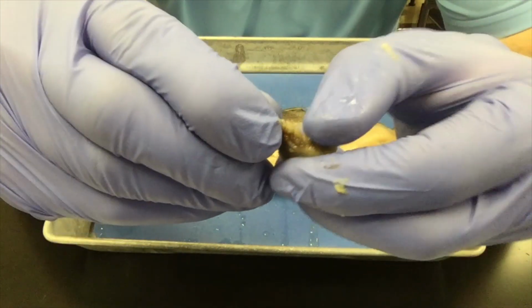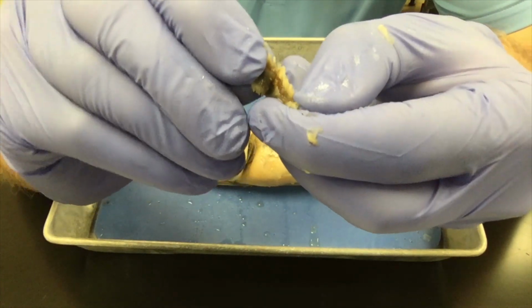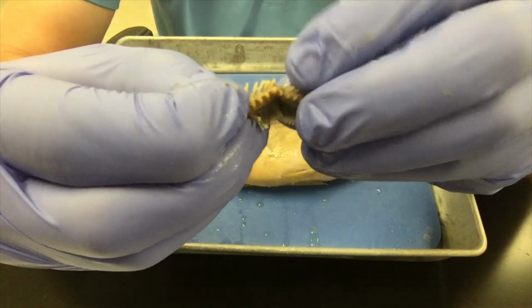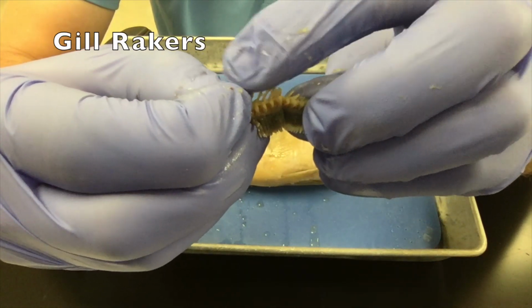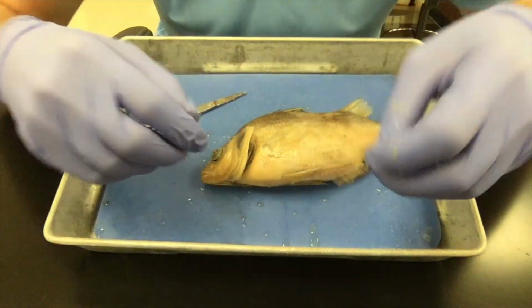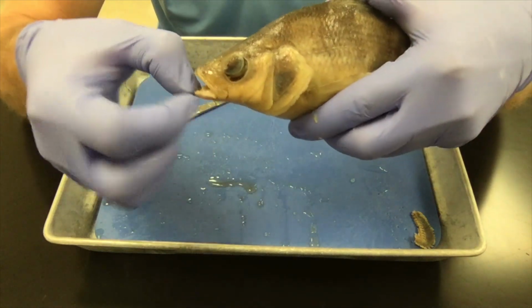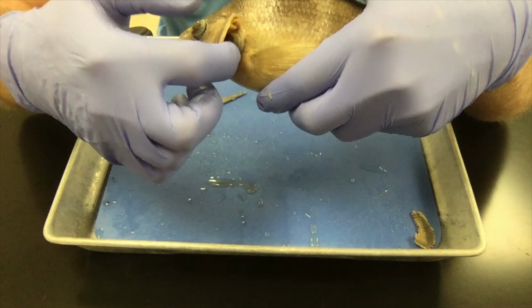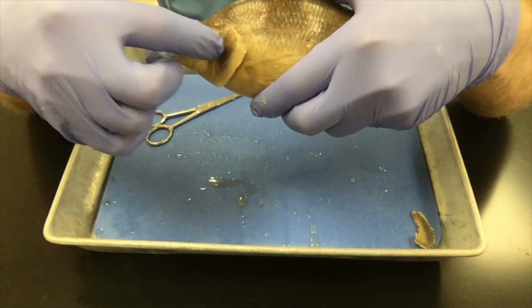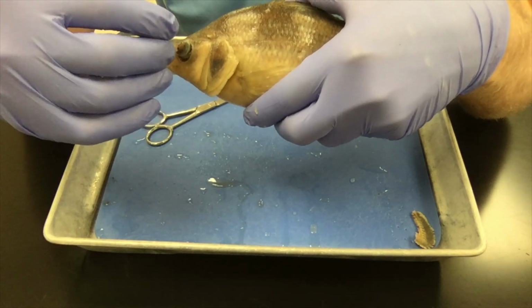And if you look on the inside of the gill arch, you see lots of little structures that look like bones or like little teeth. These are called the gill rakers. The purpose of the gill rakers is to keep food inside of the fish's mouth. When the fish wants to breathe, right, he opens his mouth, sucks water in, and then squirts it out through this hole behind the operculum. Sometimes his food might go with that water, and so the rakers act like prison bars to help keep the food inside of his mouth.